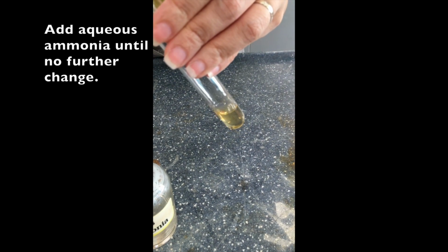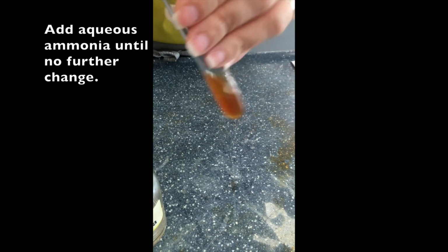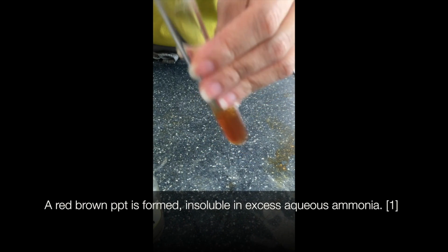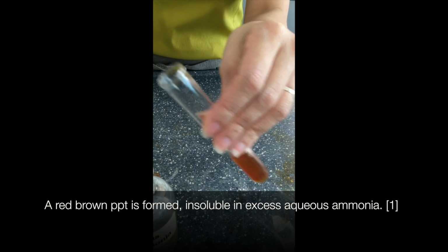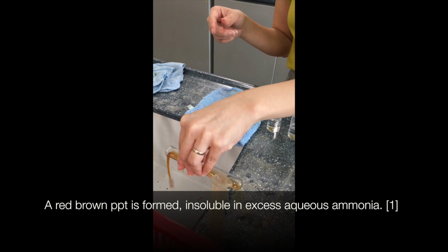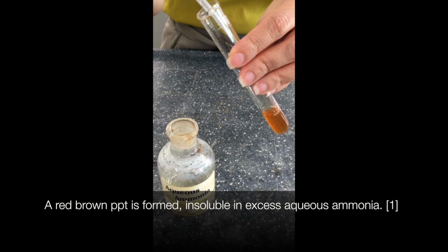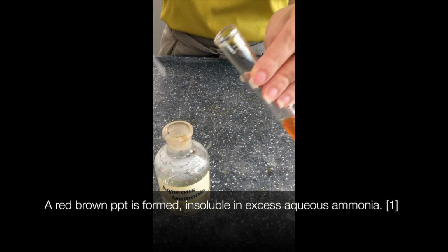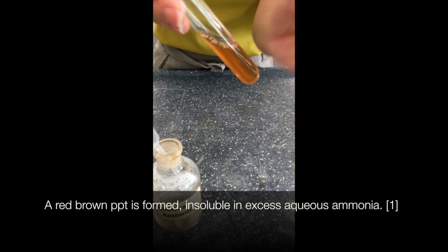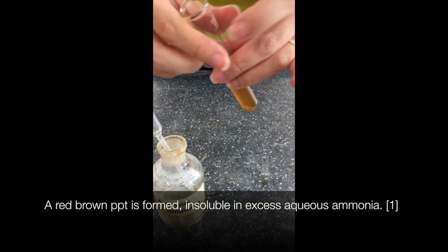So if you look at it closely, this precipitate, based on the chart, would be a red-brown precipitate. Okay, you should add more of this aqueous ammonia. Pour away some because you want to see if it's soluble or not. Okay, and add more aqueous ammonia up to 1/3 or half a test tube, at least 3 times the original amount. So with shaking, the observation is that a red-brown precipitate is formed, insoluble in excess aqueous ammonia.